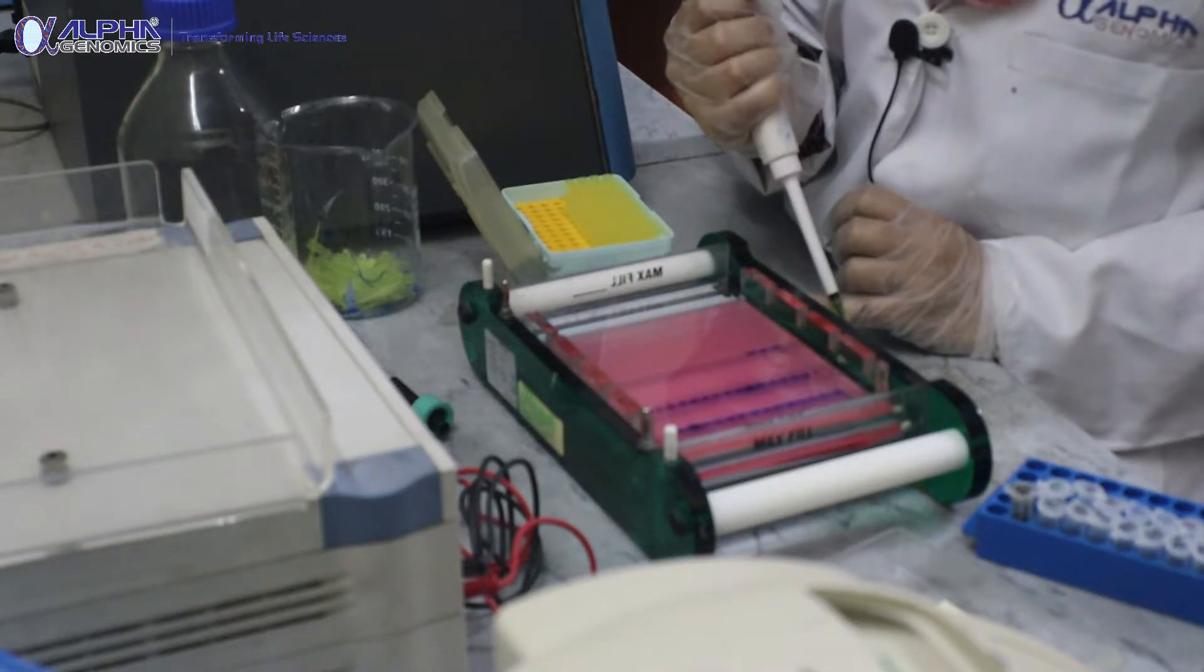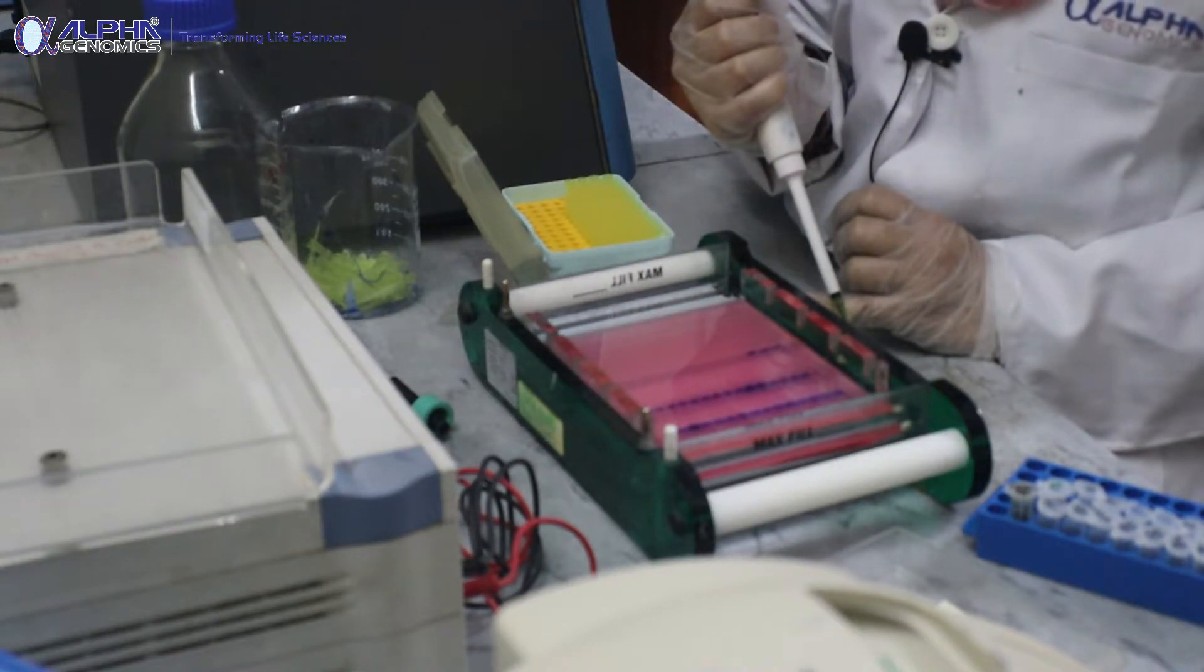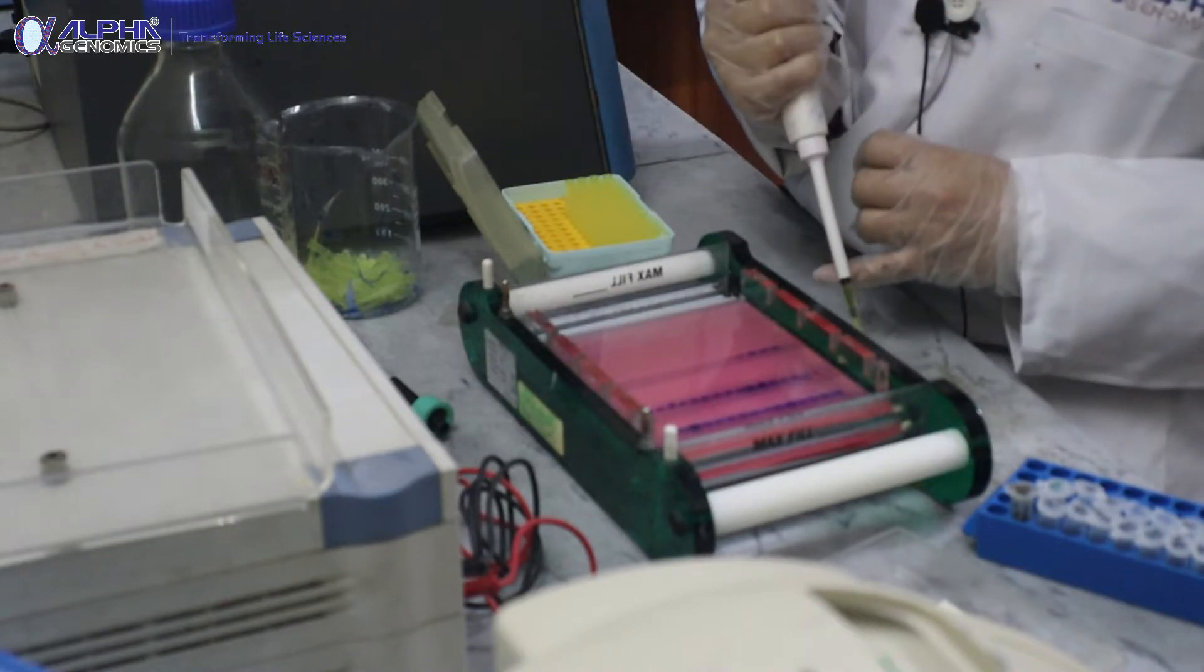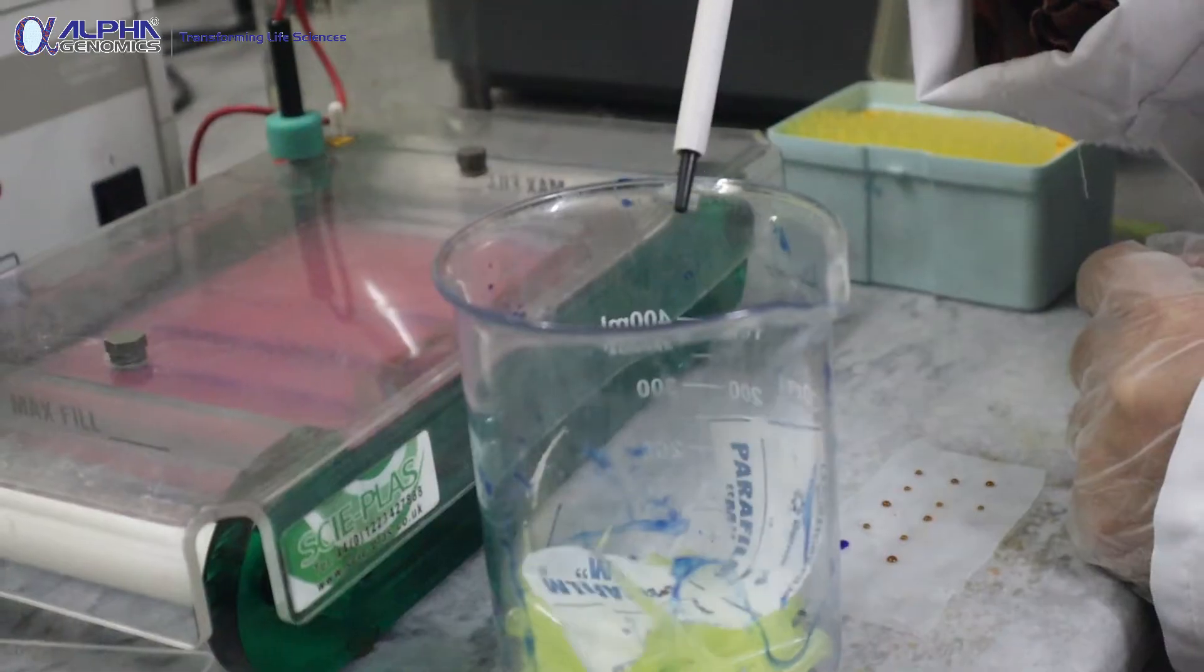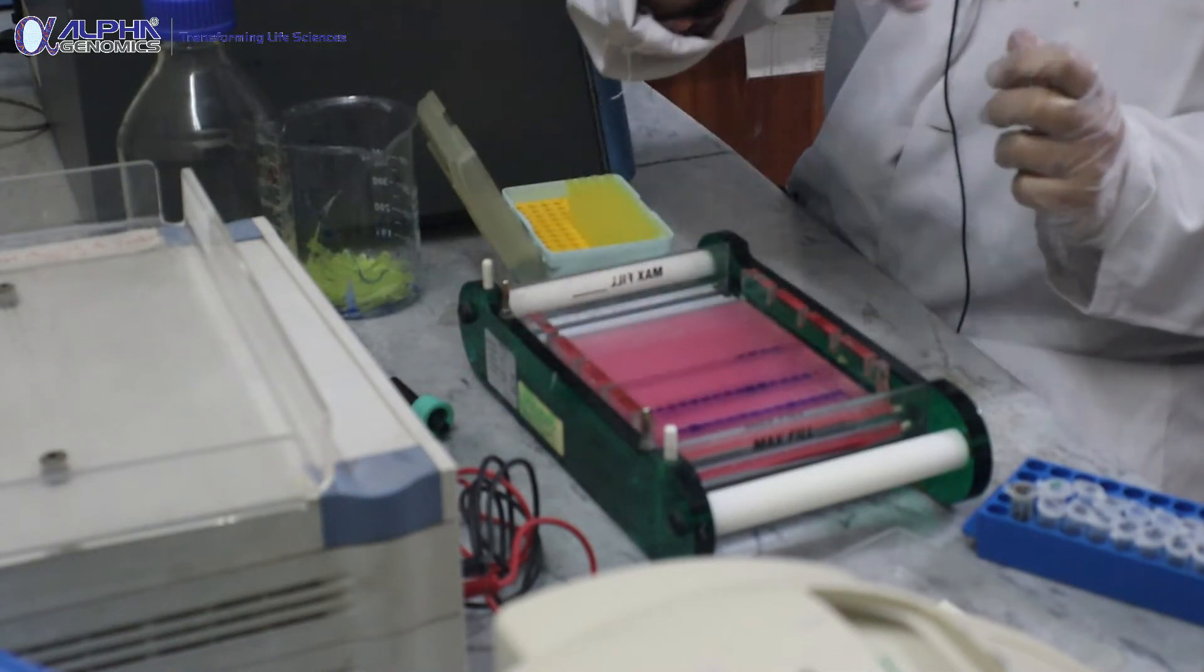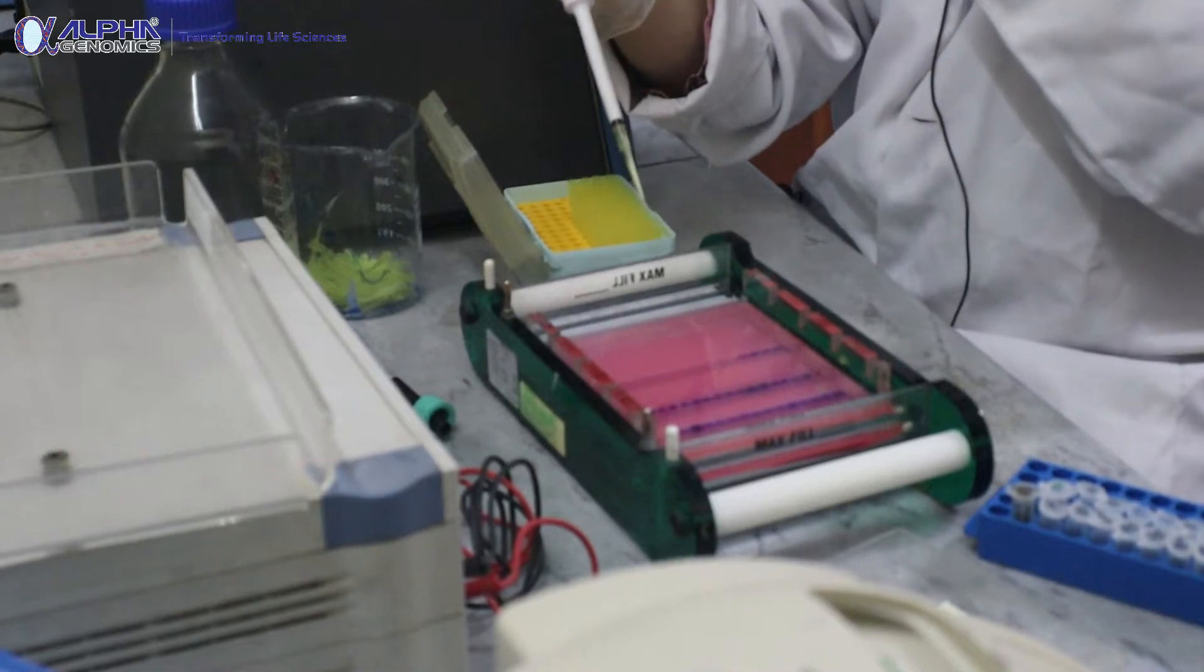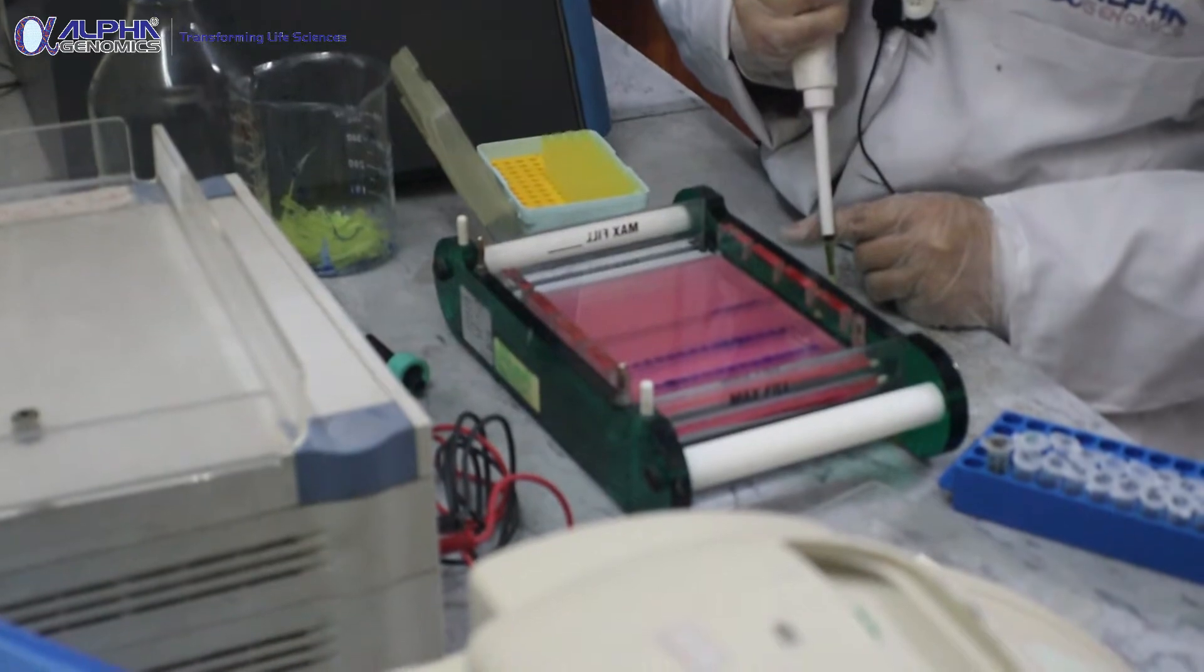When you are loading the gel, keep in mind that the pipetting should be very gentle. You shouldn't quickly or vigorously mix this DNA with the bromophenol blue because vigorous pipetting normally lets air bubbles accumulate and there's a chance of inaccurate loading. Try not to keep your hand hanging over the gel - give a little support to your hand so you can load properly.